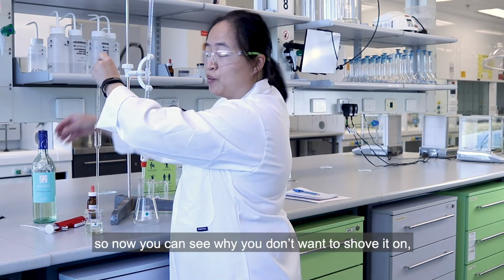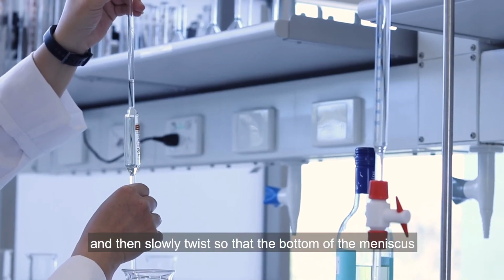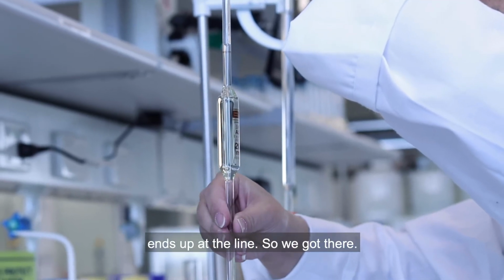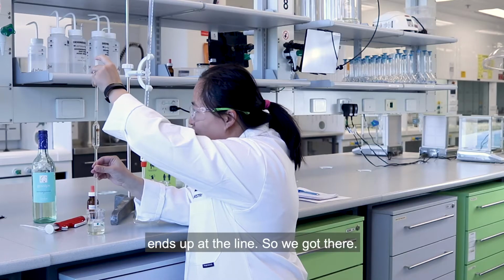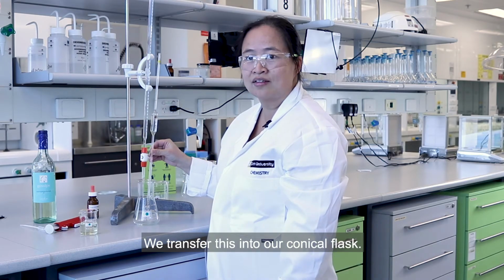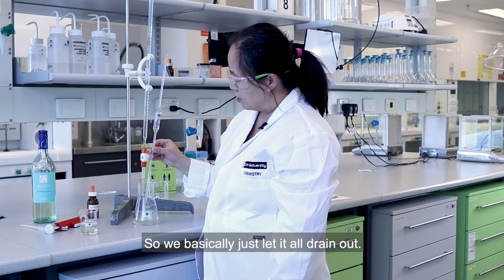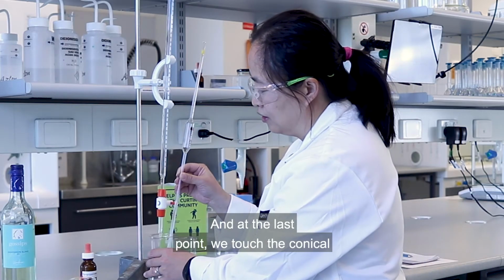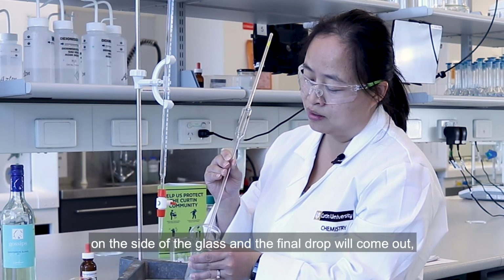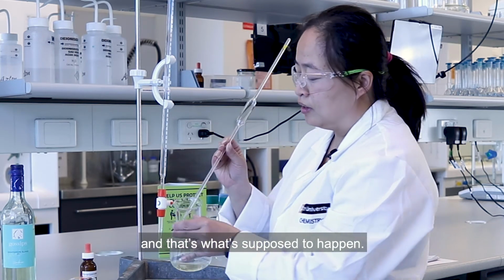So now I can see why you don't want to shove it on, because it's hard to get off. And then slowly twist so that the bottom of the meniscus ends up at the line. So we've got there, we transfer this into our conical flask. So we basically just let it all drain out, and at the last point, we touch the conical on the side of the glass, and the final drop will come out. And that's what's supposed to happen.